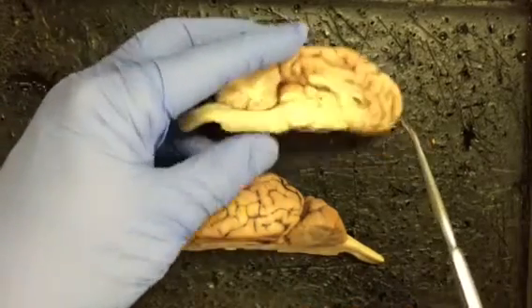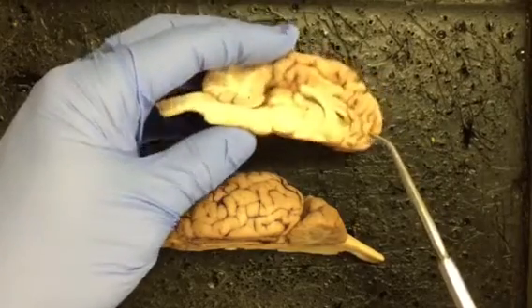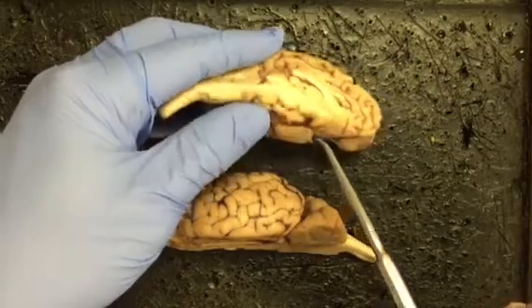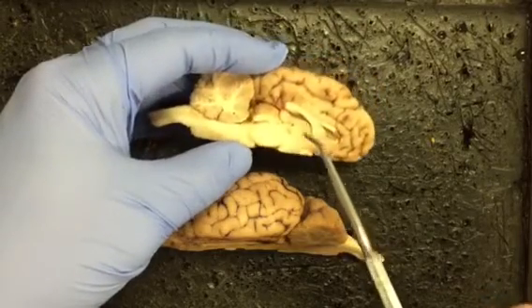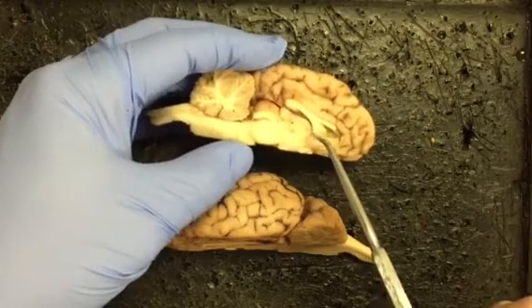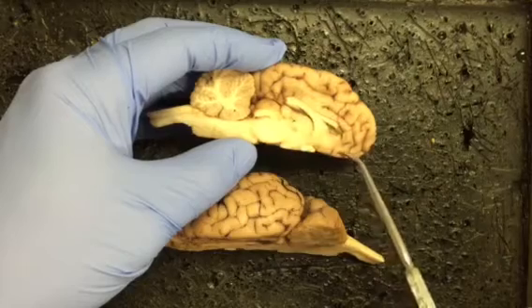We have the olfactory bulb, which, if you recall, was in this front region. We have the mammillary bodies, which would be down here below the thalamus. Remember that we saw them as enlargements on the outside view. This is one of those 2. They are paired. We have the thalamus, or the intermediate mass, in the middle of the brain right here. And then just below that, we would have the hypothalamus.